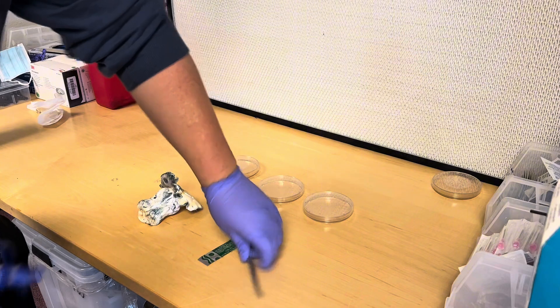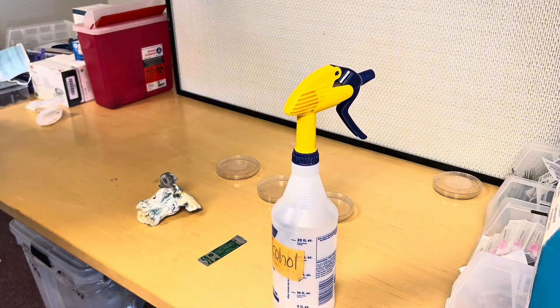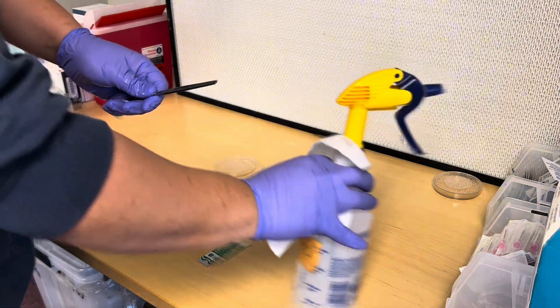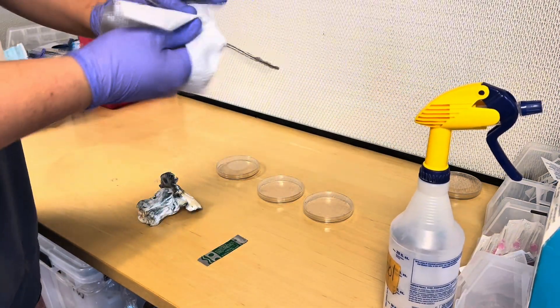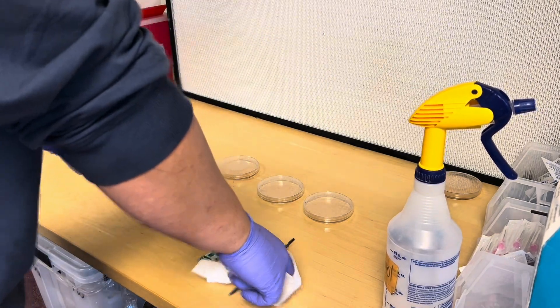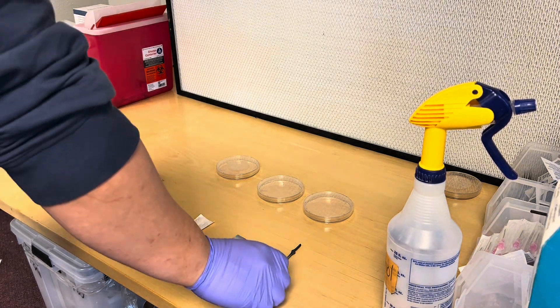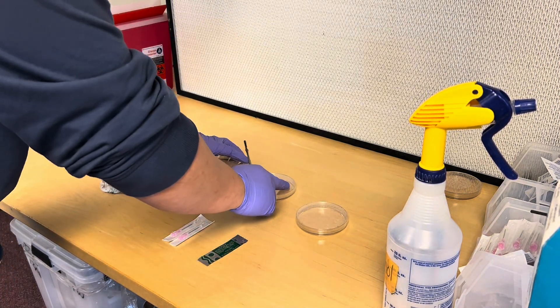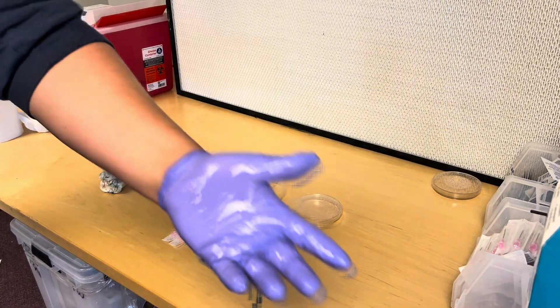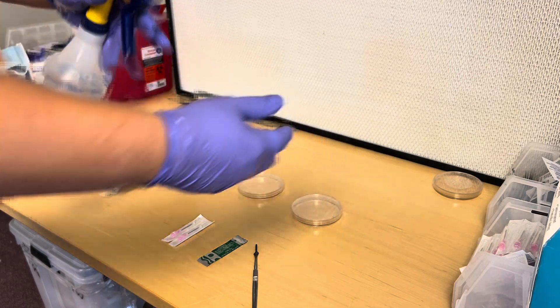After you get to a room with as little airflow as possible, clean down your workspace with 70% isopropyl alcohol, spray your gloves down, and get all your stuff ready. Move all your agar plates over — I'm going to be taking three tissue clones. Wipe down your scalpel with 70% isopropyl alcohol. If you're using a normal knife you would flame sterilize it, but I don't need to because I'm using pre-sterilized scalpel blades.